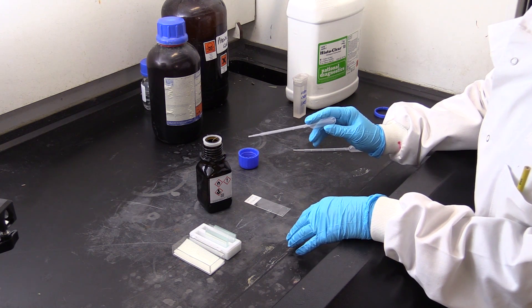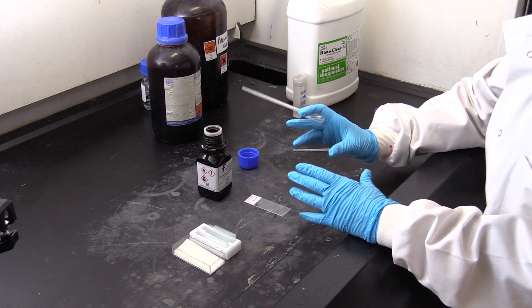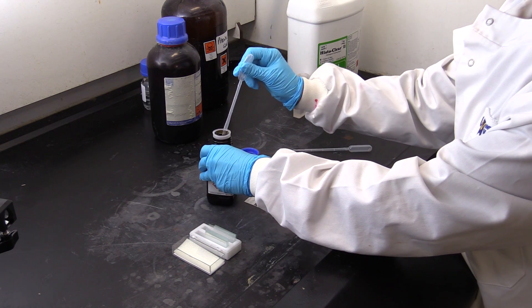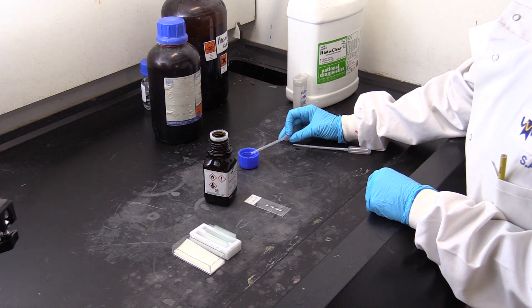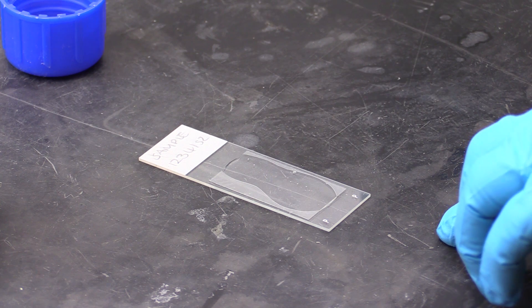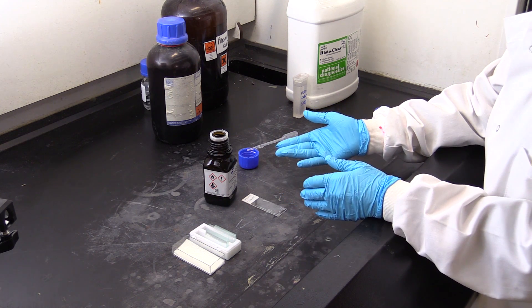The final stage in the sample preparation is to put a cover slip onto the slide to preserve the material, protect it, and allow you to view it under the microscope. The mounting medium we use is DPX mounting medium, which has the same refractive index as glass so you can easily see the sample. Make sure you don't get any air bubbles. Take a little DPX into your pipette and place it onto the slide. Take your cover slip, place it at an angle onto the slide and then drop it on, gently tapping down so all the air bubbles move out to the side and the mounting medium spreads along. Leave the slide in the fume hood for a few minutes so the fumes evaporate off, then look at it down the microscope.